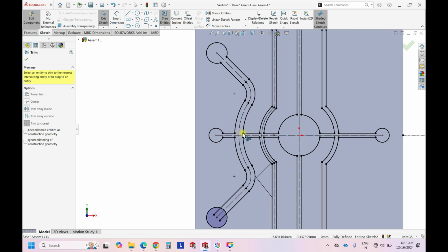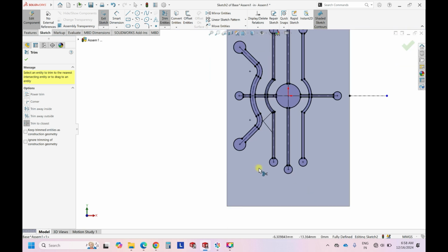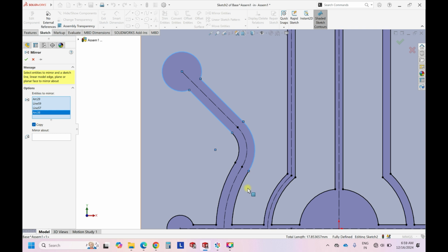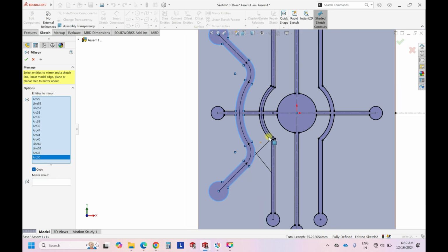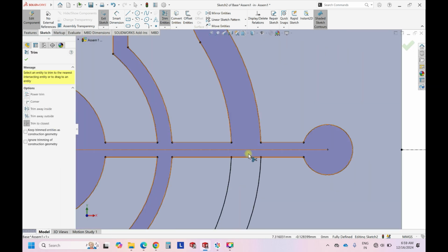So I have a doubt whether the channels are interacting with each other or they are from under the plane. So to the viewers, if it is under the plane, let me know. We can do another video on how to do the plane above and plane below the channels. So this we can do. So once it is done, then mirror the entities. So we want this. So carefully select them. Right. And then copy about center line. Okay. And again we just have to remove these entities. Done.